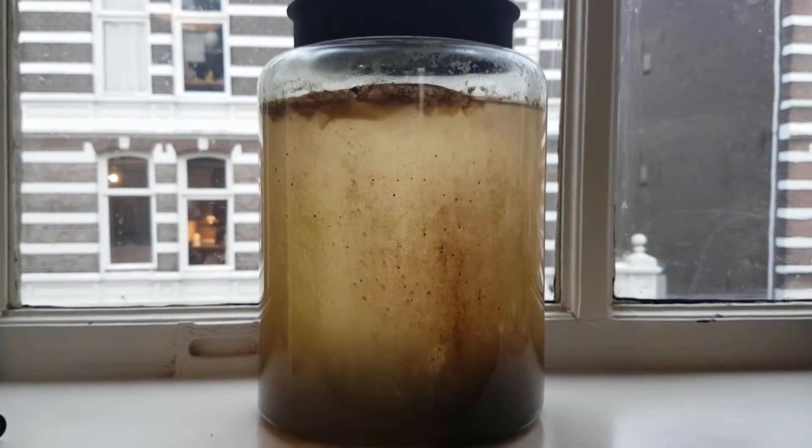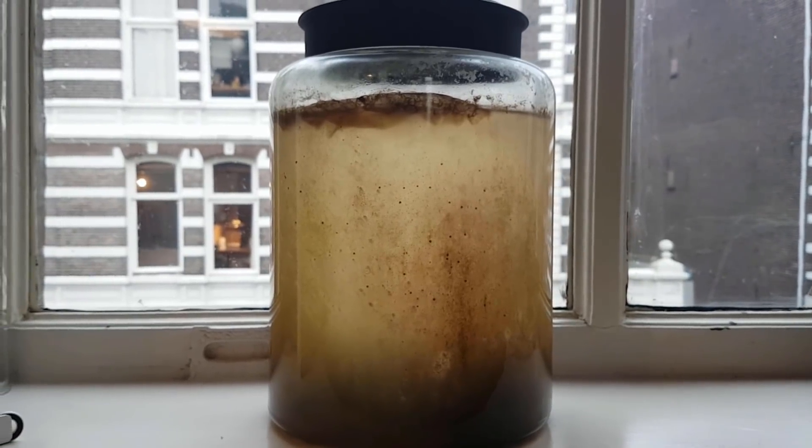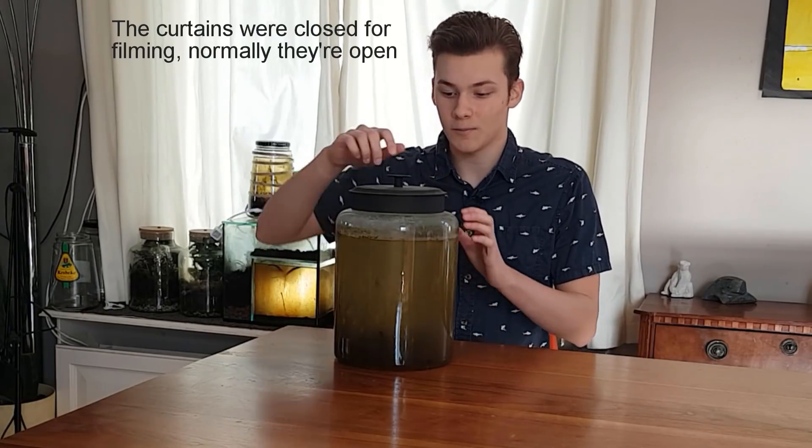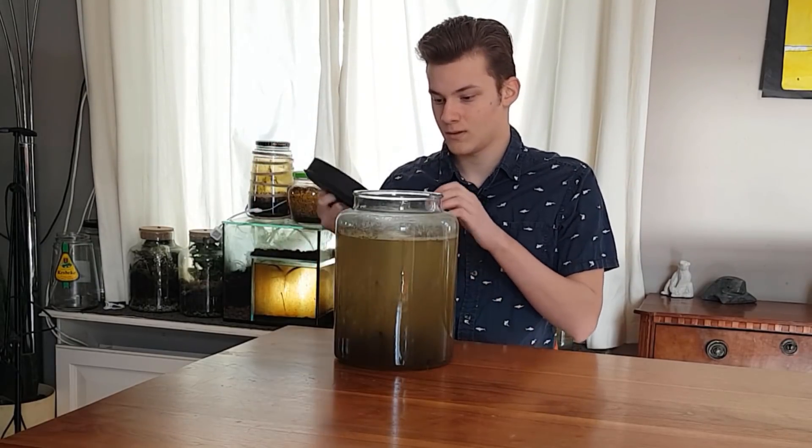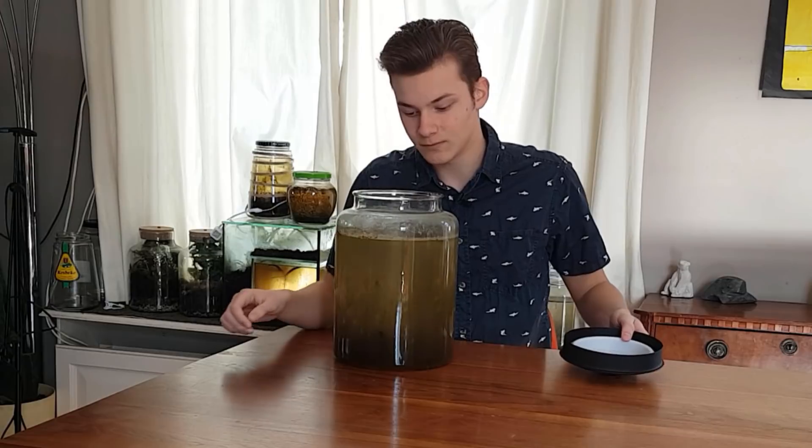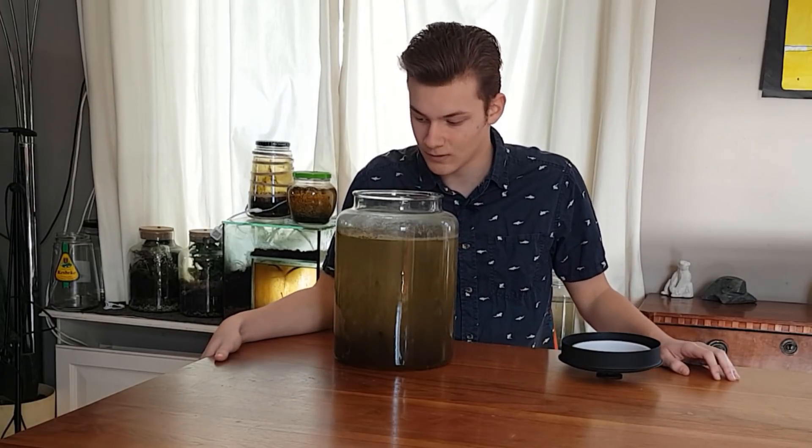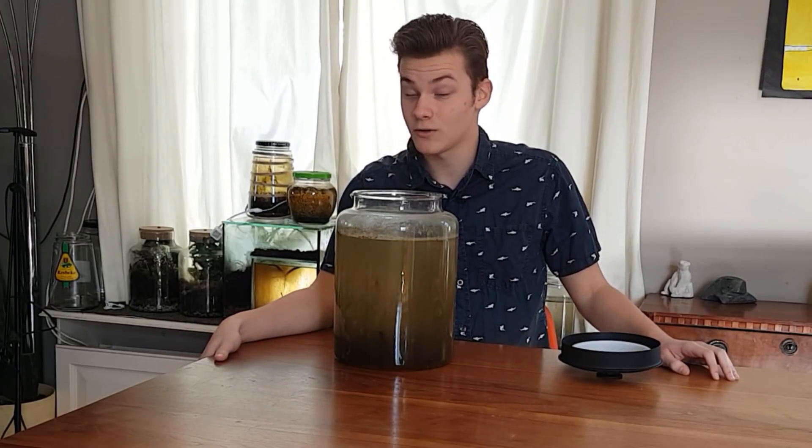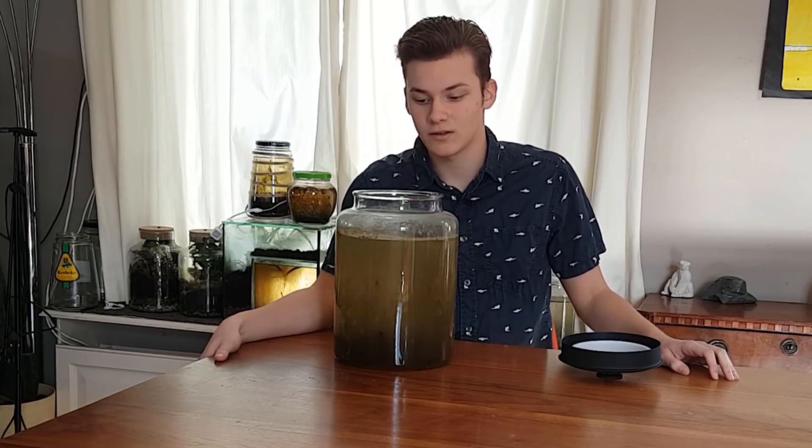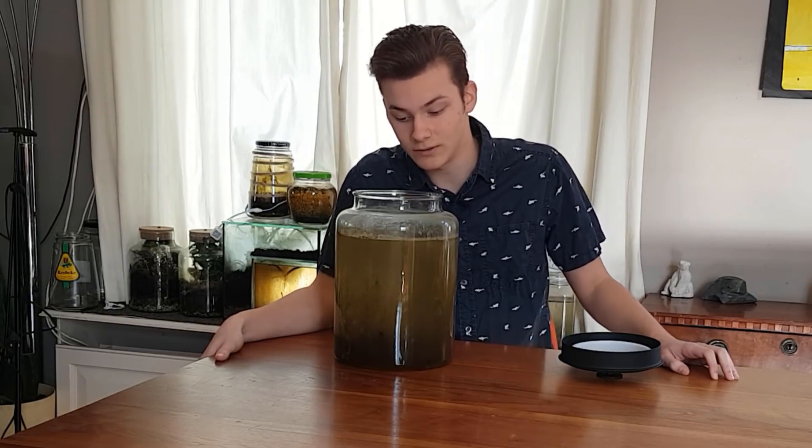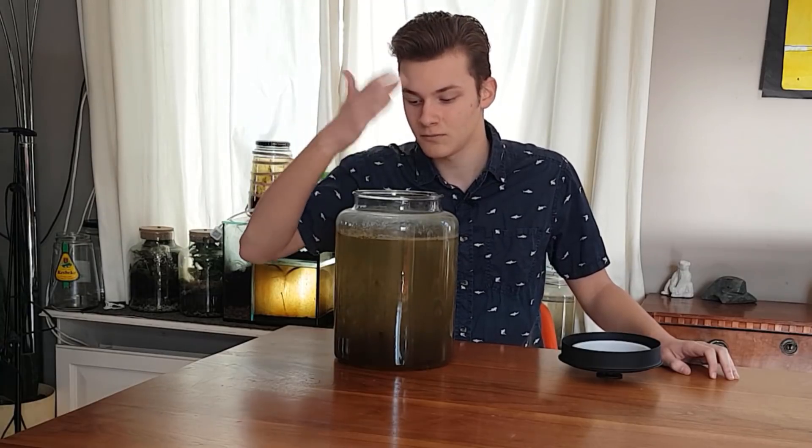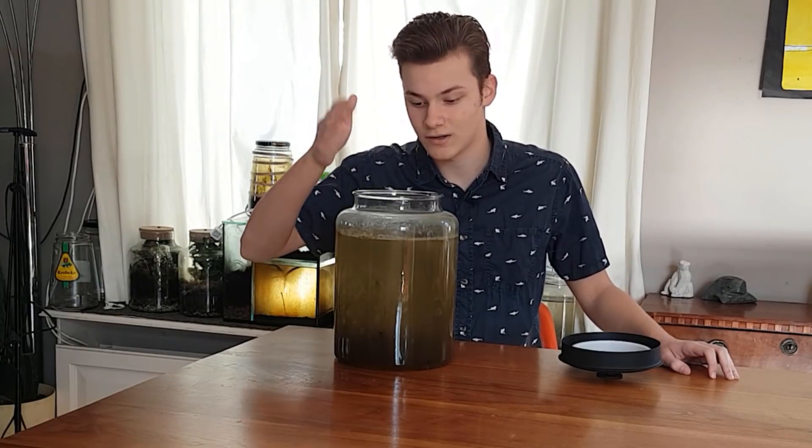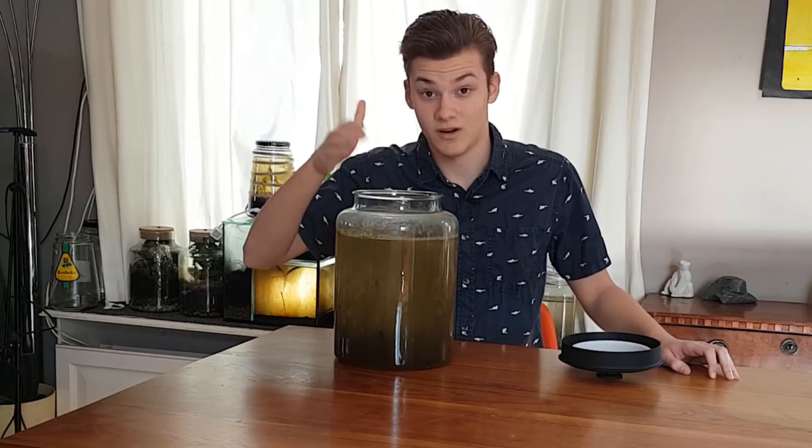After no visible change for 4 months, I decided that it was time to open it up. So let's not wait any longer and open it up and take a smell. I've never done this before. Well, actually, there was the rotten terrarium, but that's not an ecosphere, so different. Anyway, let's do the scientific way first, because you don't want to burn your nose hairs out, which I have done before.